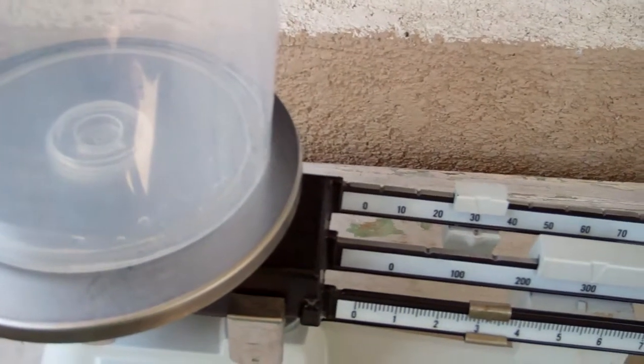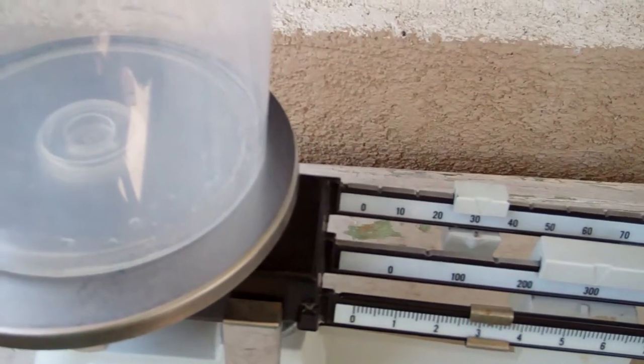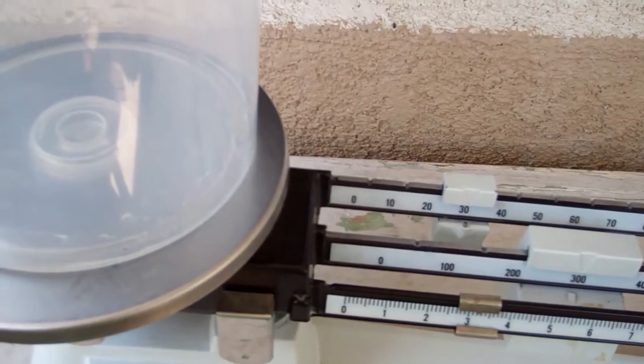and then subtract those two masses and then you will know what the mass of that water is. Now mass is not the same as volume.